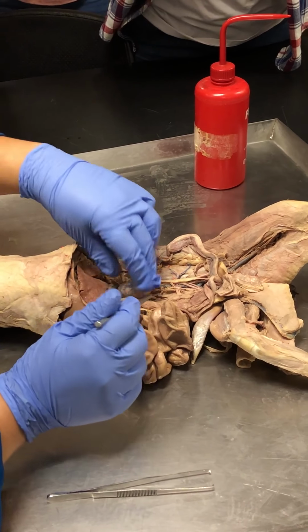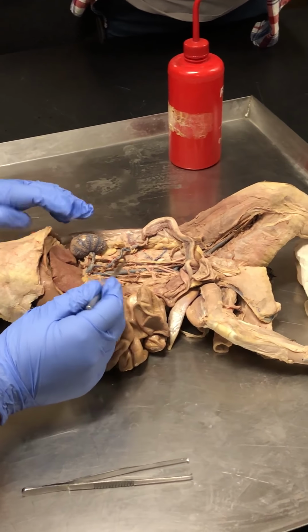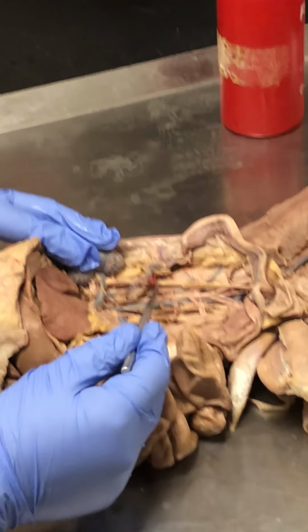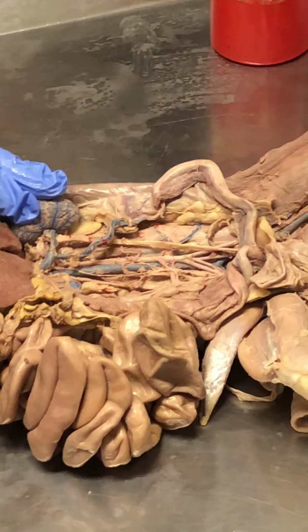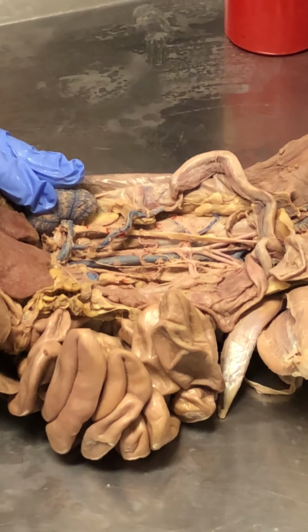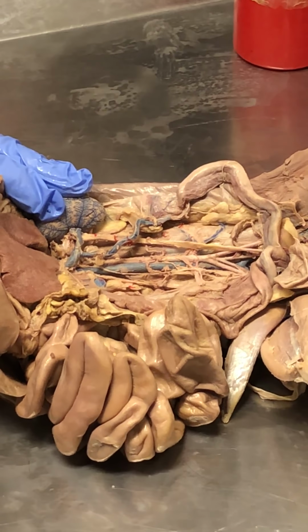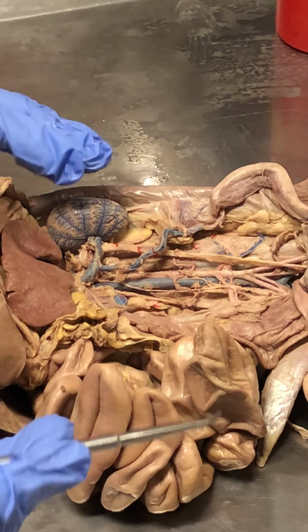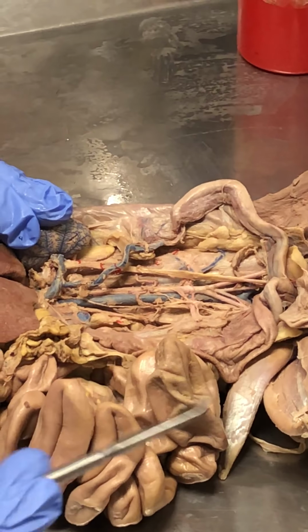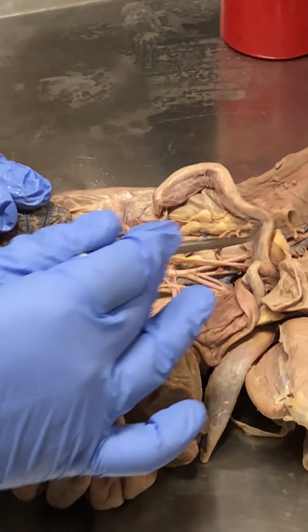Artery and vein. But the reason why I ask you to do the left is so that you can take a look at this vessel. See this vessel? Oh yeah, here's another thing. My cat got mold, so this is not my original cat. So before you work on your cat, check to see if there's mold on the arms and legs or the chest. Meaning if you see white and if it smells bad, like worse than usual. Okay. So this is another cat that I had to grab. My first cat was male. This is female, so now I got to deal with all this stuff.